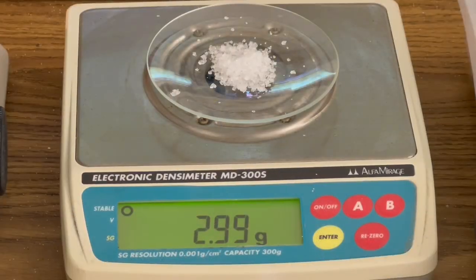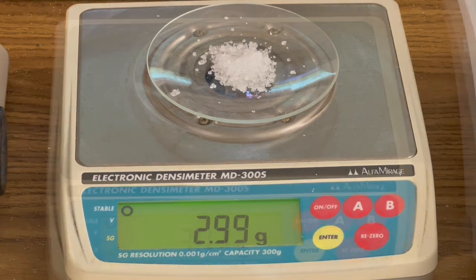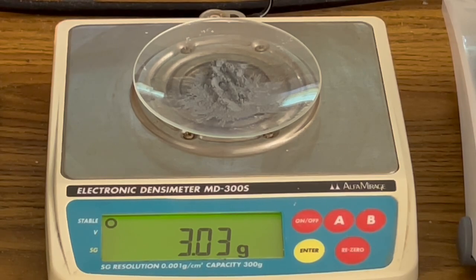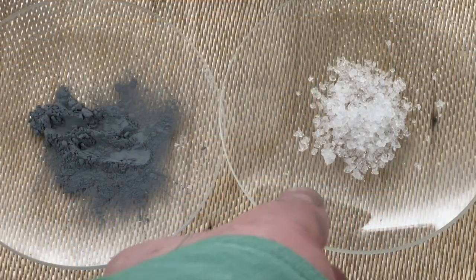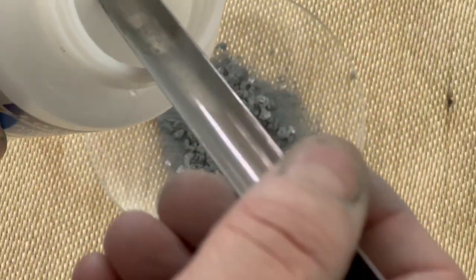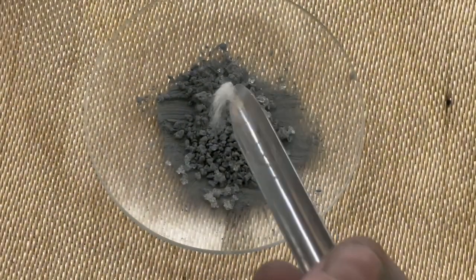Begin by measuring three grams of ammonium nitrate. Next measure about three grams of your zinc powder. Next start mixing the two reactants together, and now you're ready to add just a very small amount of ammonium chloride as a catalyst, and you're just going to mix this with your reactants.